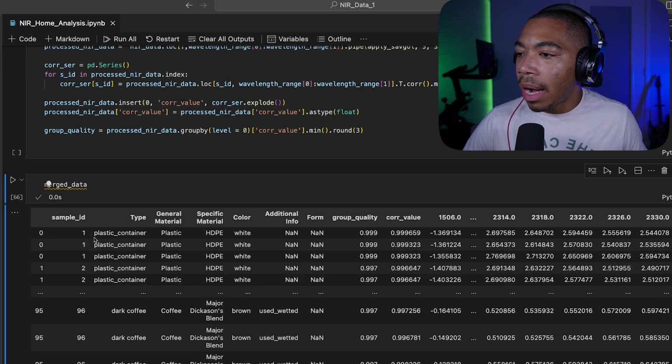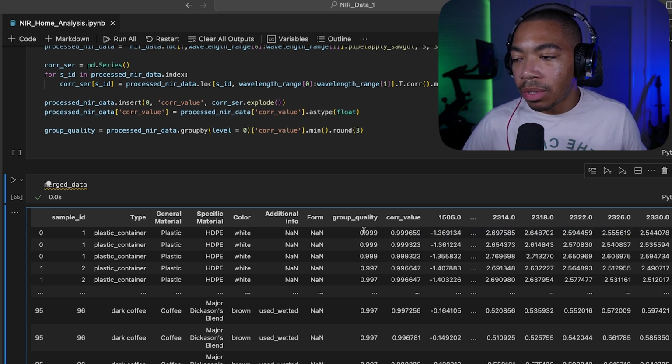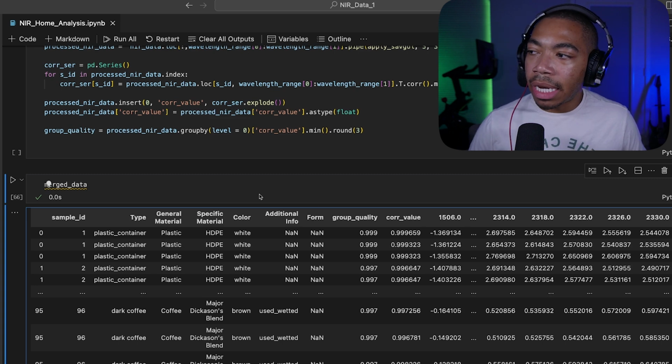We have now our sample ID, our plastic type. We have this group quality. So I'm now just returning the minimum value, but I'm also just using the first 3 decimal points. And we have all of our processed NIR data.